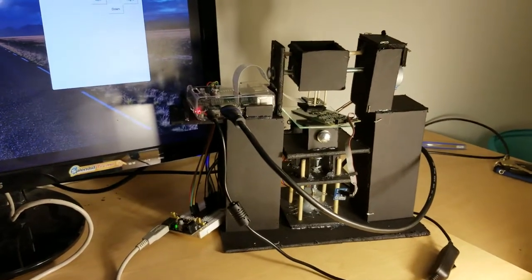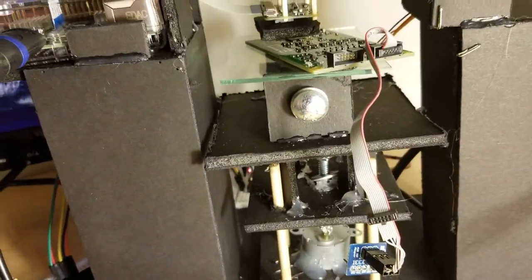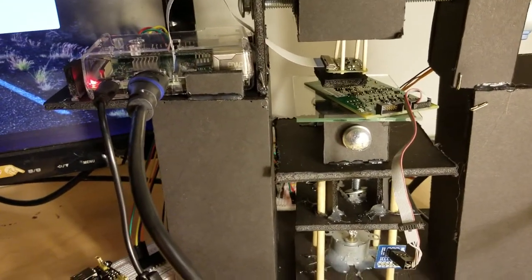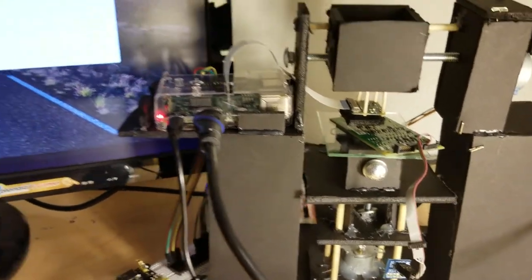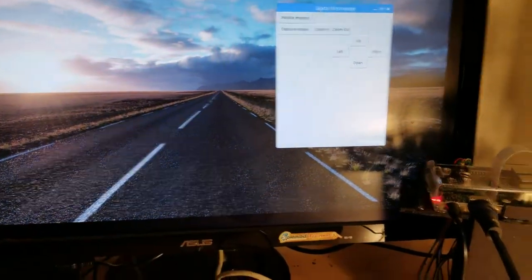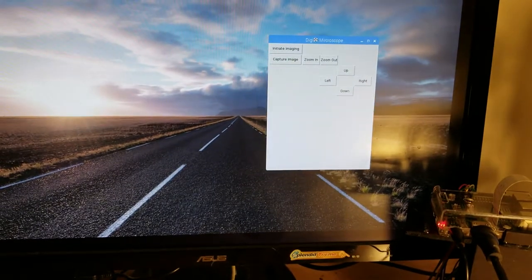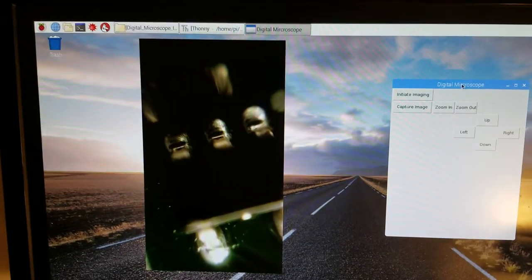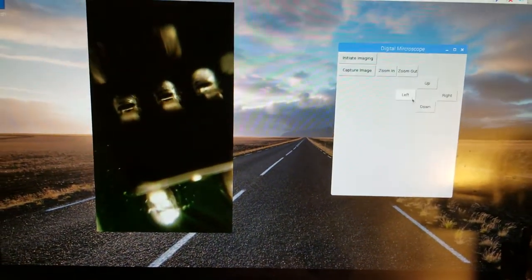This is the slightly longer demo video of my 122A project, my take at a digital microscope. Already I have set up the Atmel programmer beneath the camera, and I'll be going a little more in depth about how this microscope works, some of the issues I had, and what I've done to work around them. I'll also be going over again some of the more basic functionality. To get started, I have this little page open and I hit initiate imaging. Initiate imaging opens up a window, and you can see that the microscope is enlarging our programmer chip.